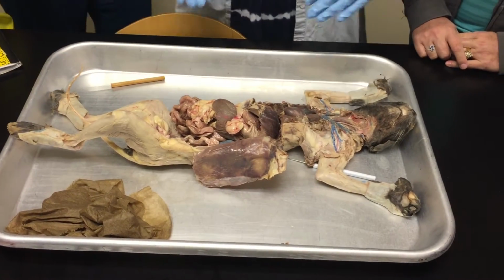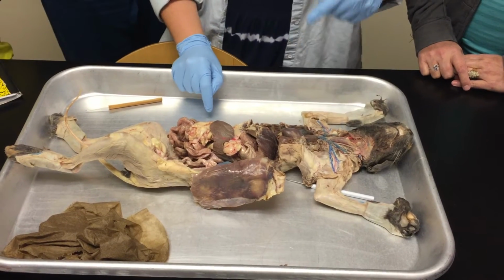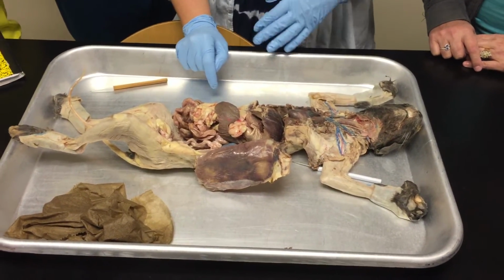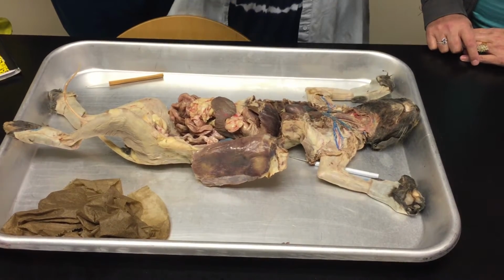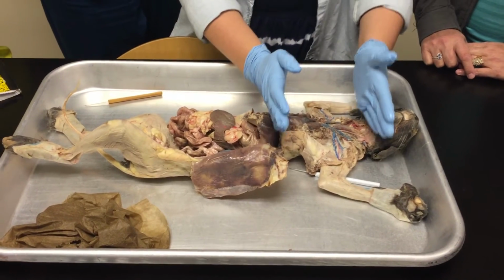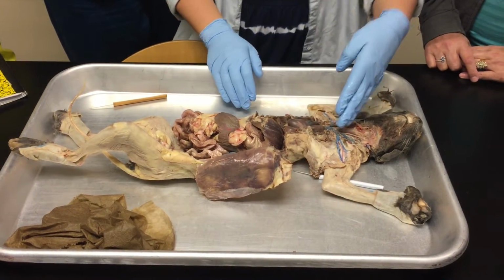All right, so arteries and veins, going through the arteries and veins. Veins have been injected with a blue latex dye. Arteries have been injected with a red latex dye, just so that you can visualize them and they hold their shape a little bit better. In the thoracic, like in the upper part of the body, the veins are going to lie on top of the arteries, so you'll see them first.